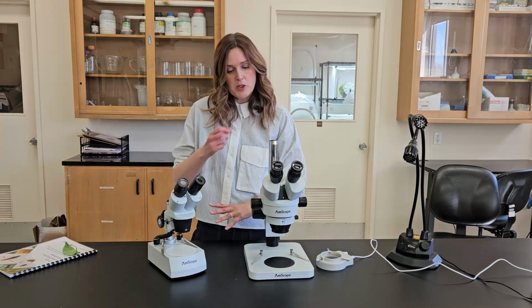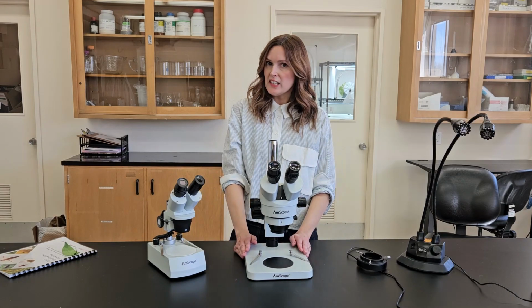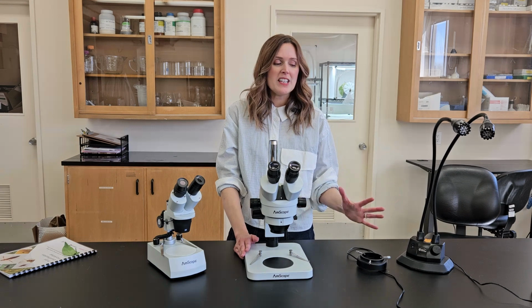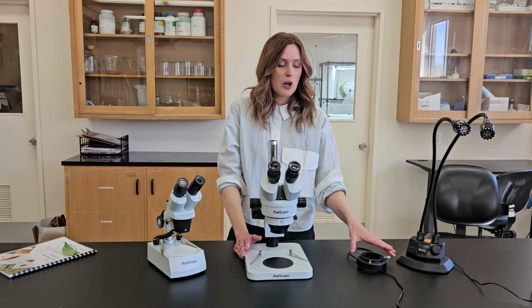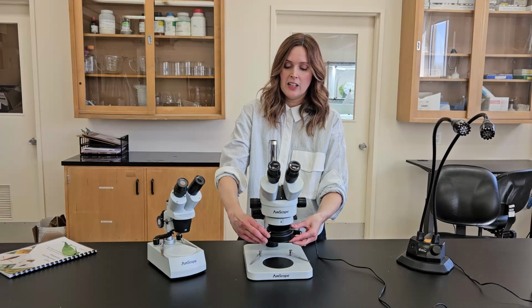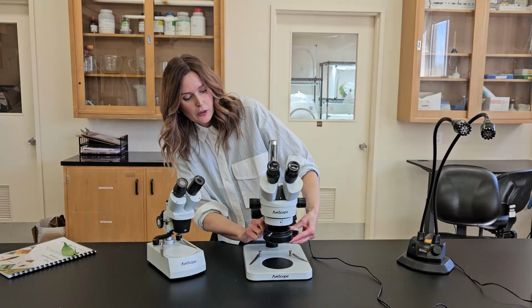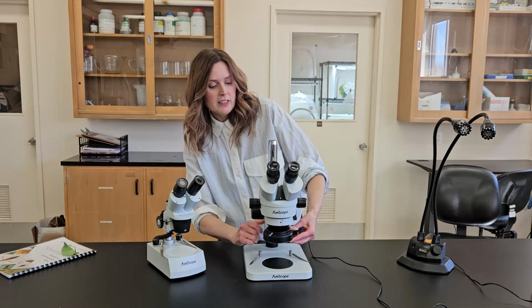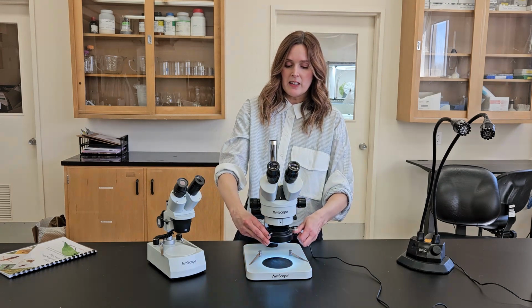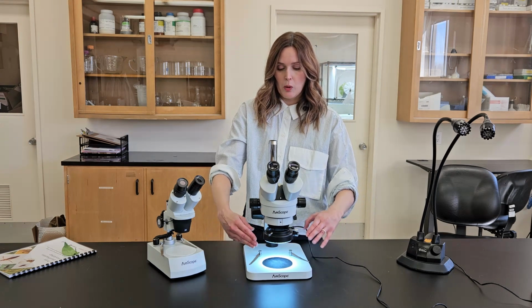So that's one option. So this middle of the road option doesn't come with its own light source, you might have noticed. So you can buy external light sources. And this does add to the cost of the microscope, but these aren't going to break the bank. So the first and cheapest option is what's called a ring light. And so this actually attaches to the body of the microscope with little screws. And so just be patient with me for a second. Okay, that's on enough. And so then it's got an on and off button, and then you can decrease or increase the brightness, and it gives you a really nice light field to work with.